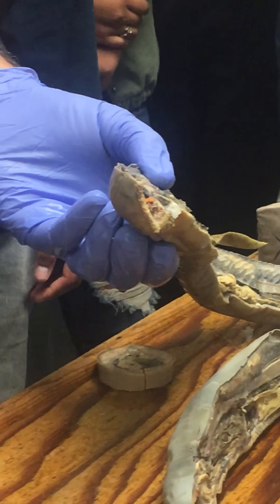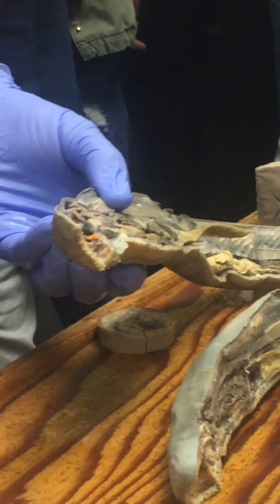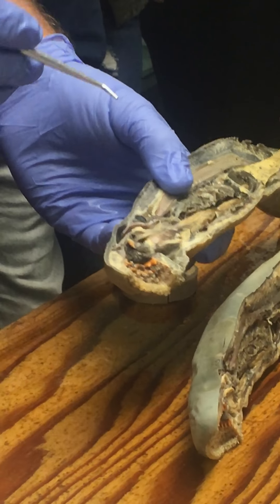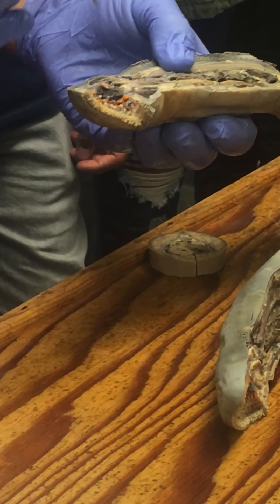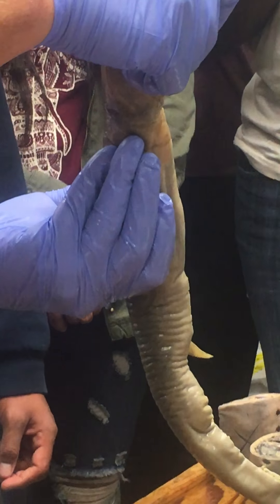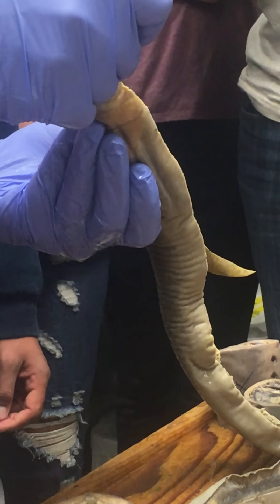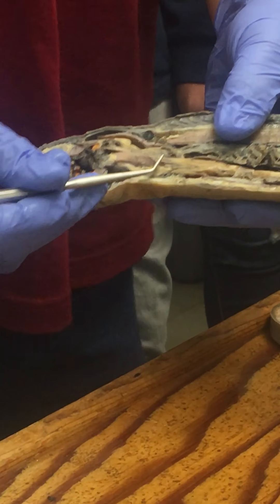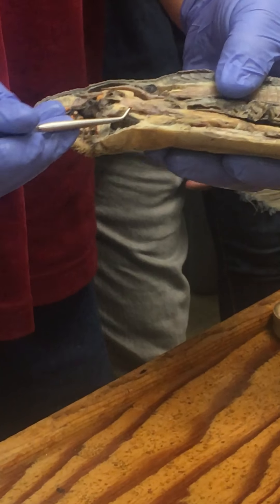There's a nice diagram in Walker showing the whole chondrocranium. The lingual cartilage — lingual means tongue — is the cartilage of the tongue, right here. It basically extends from the tongue back and gives the muscles that move the tongue forward and back something to hold on to. That's the lingual cartilage.